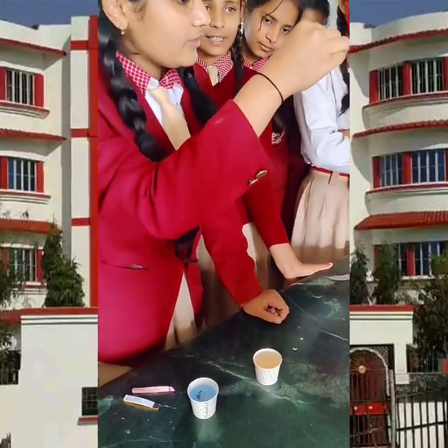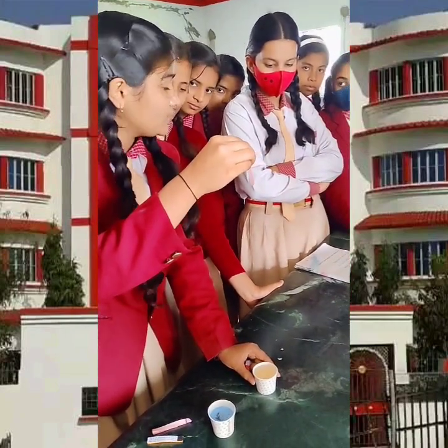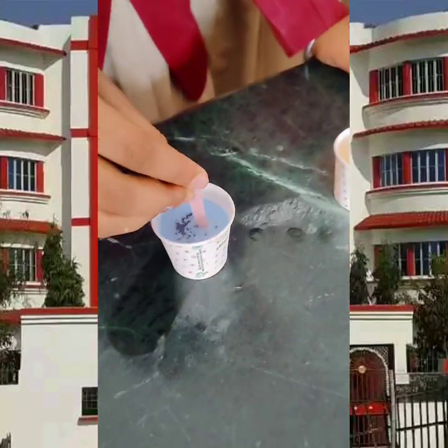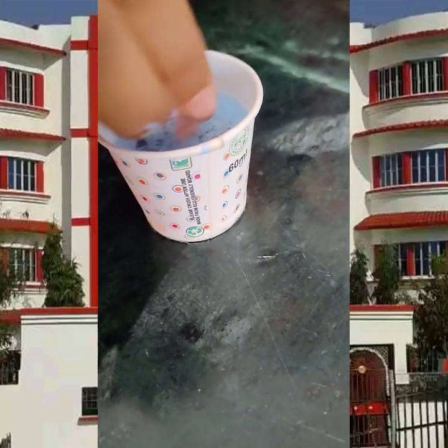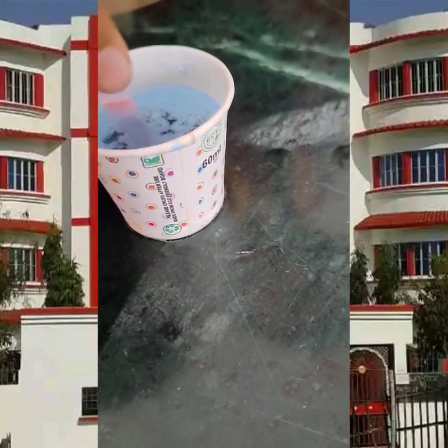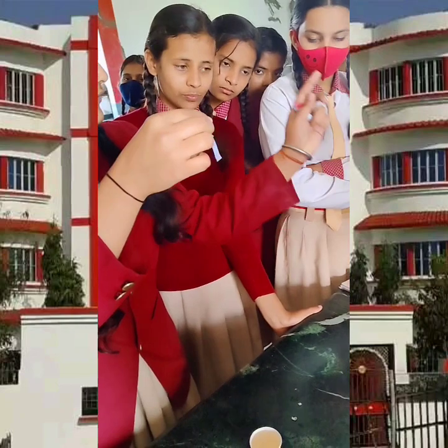Everyone can see that? Yes. First of all, it was the blue litmus paper, but after putting it in the solution of the acid — lemon — the color of this litmus paper has been changed. Now we are going to put this in the solution of base. So what do we observe? You can see that again it will turn into its original color, which is blue.